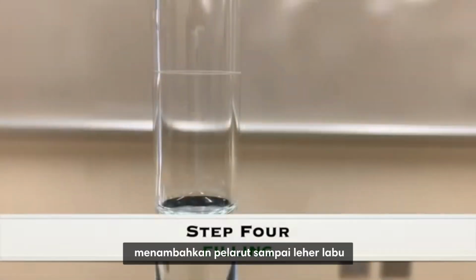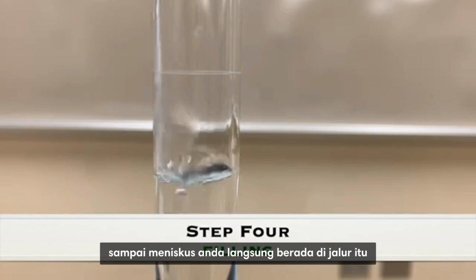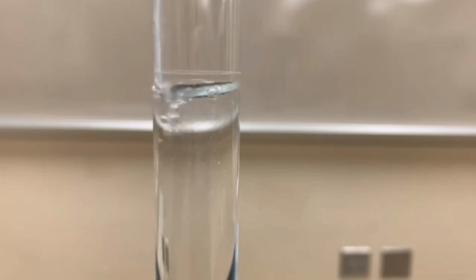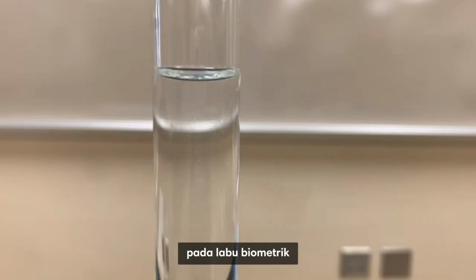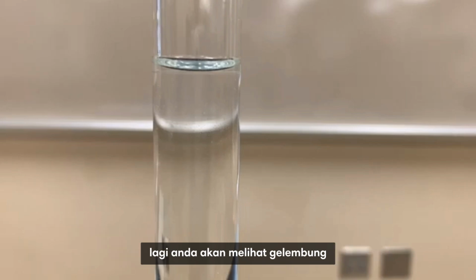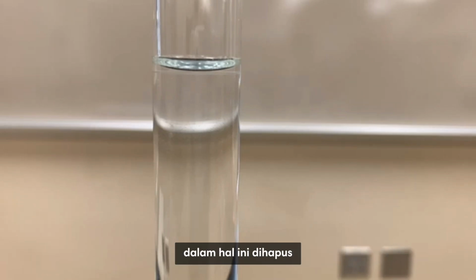So once you've added solvent until the neck of the flask, then slowly add distilled water until your meniscus is directly on that line. Slow down as you get towards the line on the volumetric flask. And you want that meniscus to be directly on that line. Again, you'll see bubbles. Those are not a chemical change. That's air that's in the solvent and the solution, in this case, being removed.